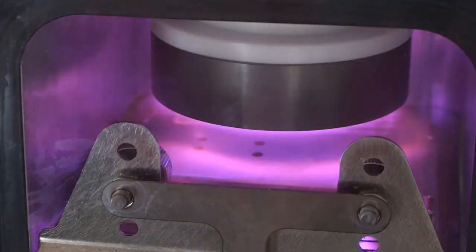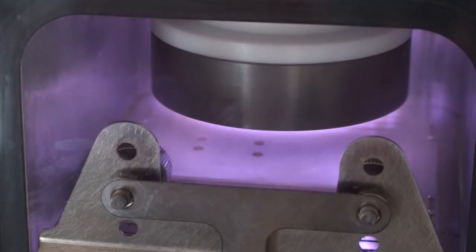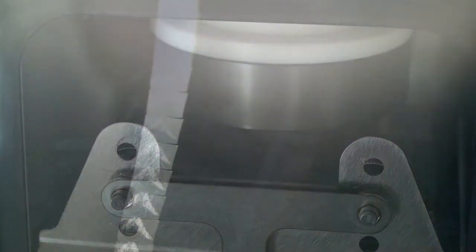Substrated grids are generally pretty hydrophobic, and so what we're going to do is a glow discharge to 20 mA for a couple minutes to make the surface more hydrophilic for picking up sections or depositing aqueous-based particles. So I'm going to pick up some sections on my freshly glow-discharged substrated grid.